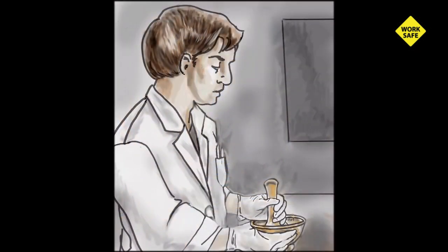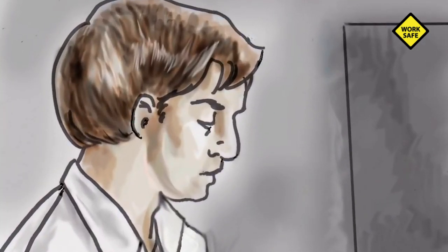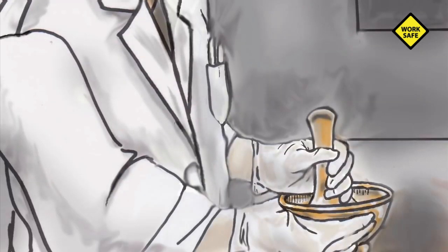A short time later, he decided to stir the compound once again. He did not replace his goggles. As the pestle pressed against the compound, it detonated.